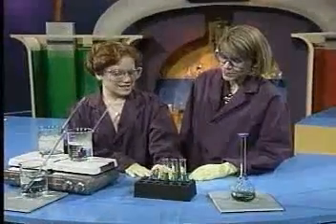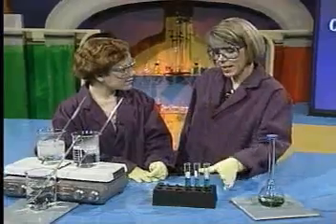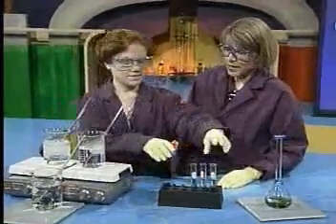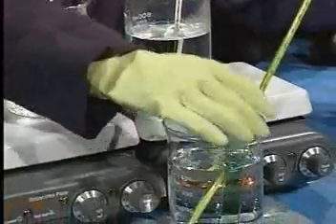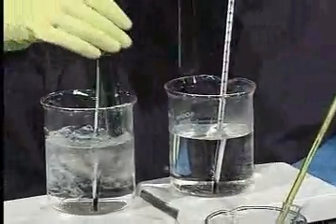Well, how are we going to study chemical reactions? There's nothing happening here. Well, there is. I'd like you to take these three test tubes and put them in each of those water baths. Okay. I've got one at room temperature, and that's it. And the other two, one in hot water and one in cold water.